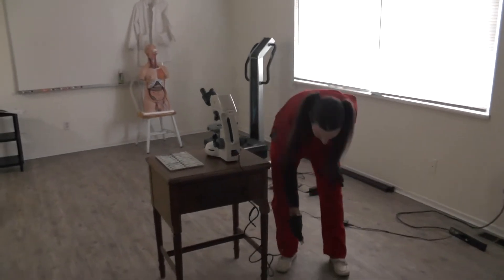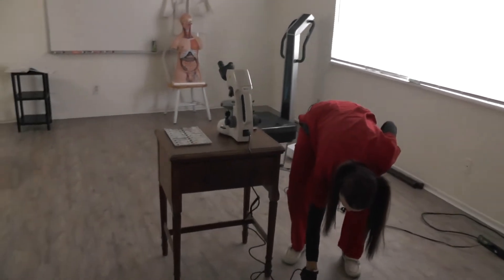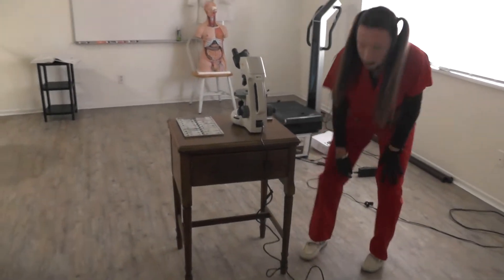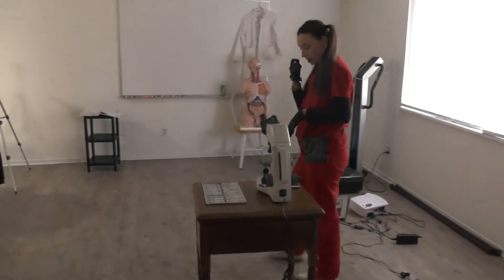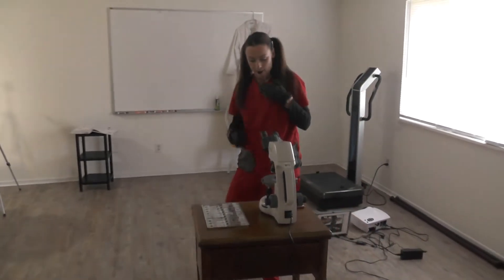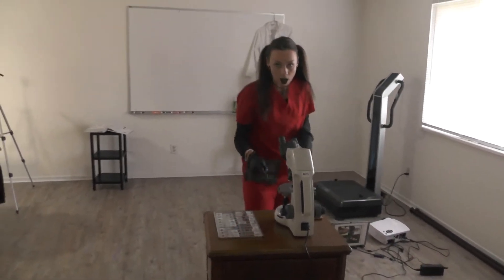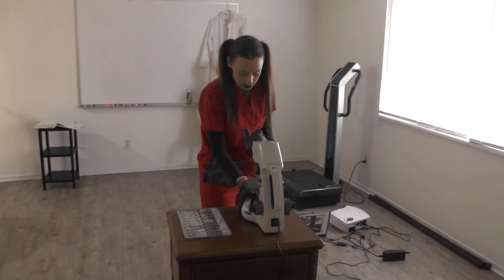Oh, you're here. I was just getting ready for you. Today they have me processing reproductive slides and respiratory slides, so I'll show you the reproductive slides.